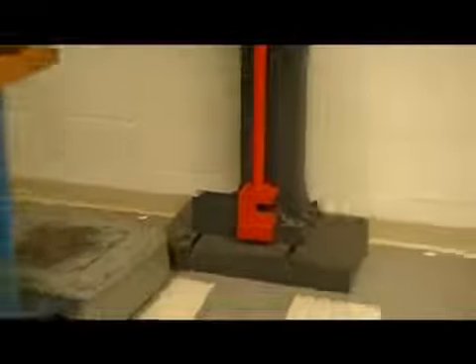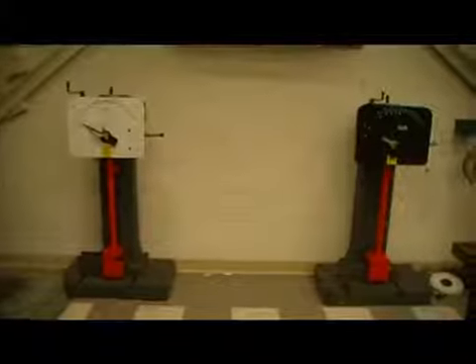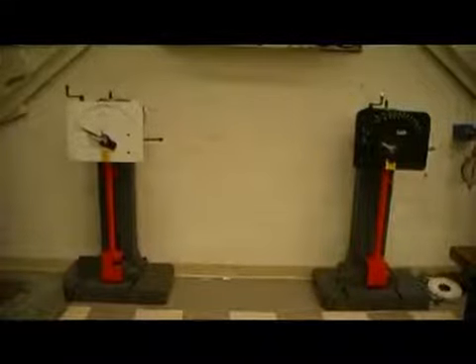Two machines will be used to affect this geometry, the Charpy machine and the Izod machine. The Charpy machine holds the sample as a simply supported beam, while the Izod machine holds the sample as a cantilever beam. Both machines operate with a large weight attached to the swing arm, which is used to perform both tests. The potential energy of the weight just before and after impact is calculated. The difference in these two values is the amount of energy the specimen absorbed when hit.